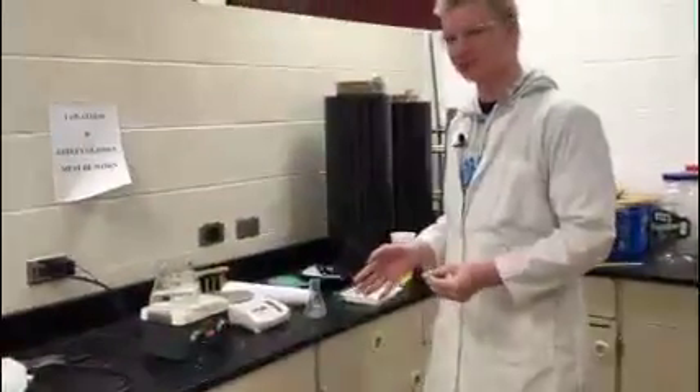Hello, we are testing water absorption, ASTM D570. The official name for this is Standard Test Method for Water Absorption of Plastics.